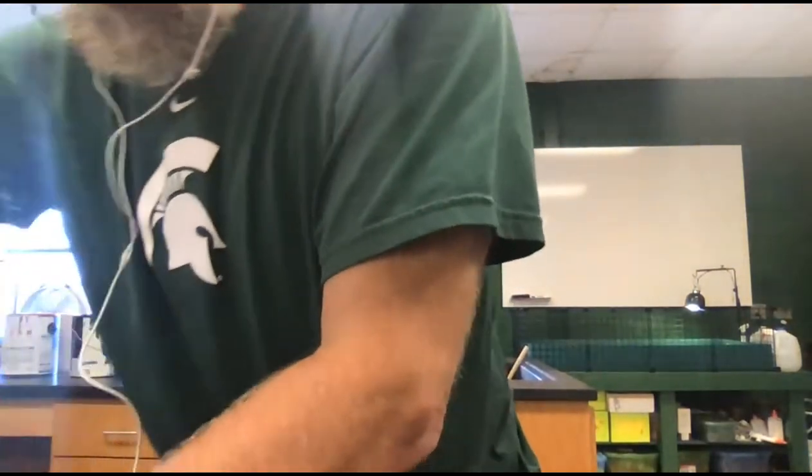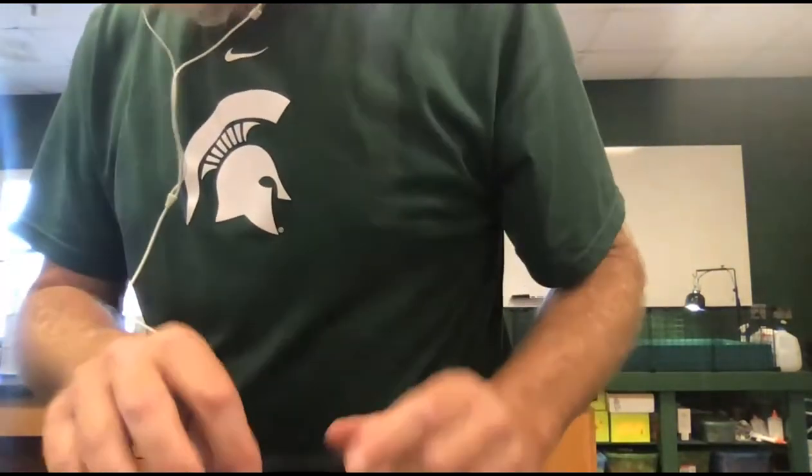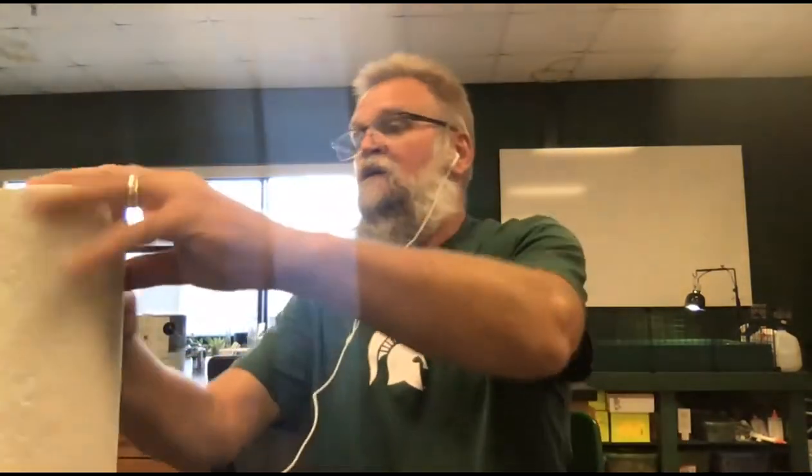And then we have another one. So then this gets into 3B, and this is about capillary action. So I have some paper towel. Let me move this seat up. And I've been asked to make a sheet of paper towel that is 2 by 10 centimeters.